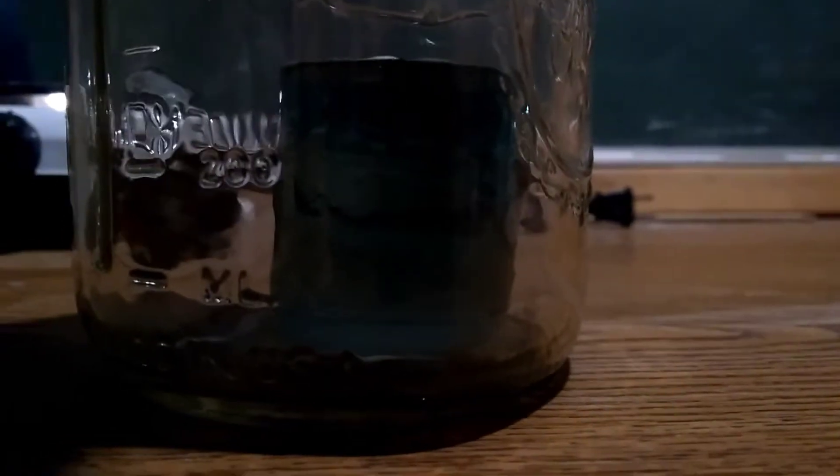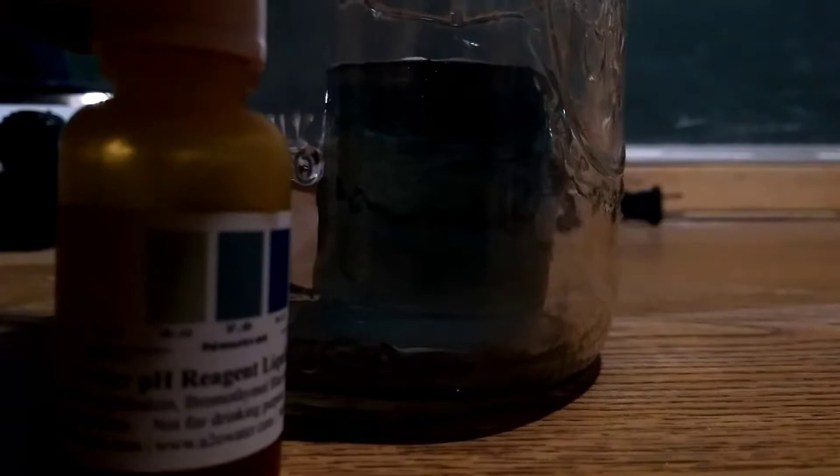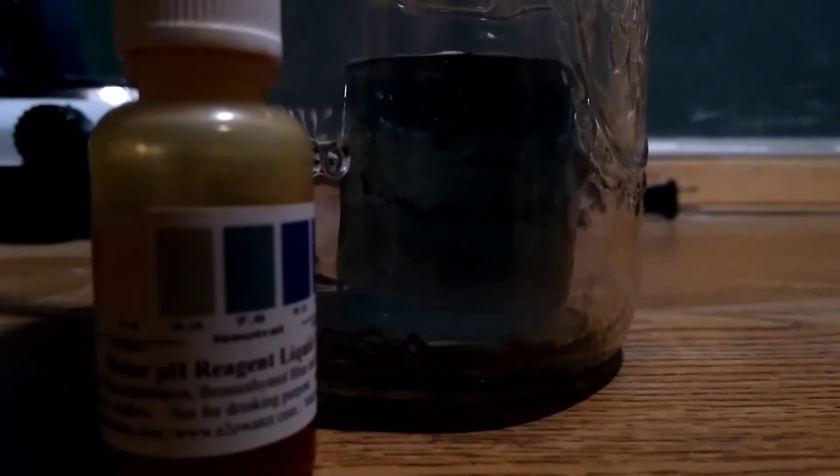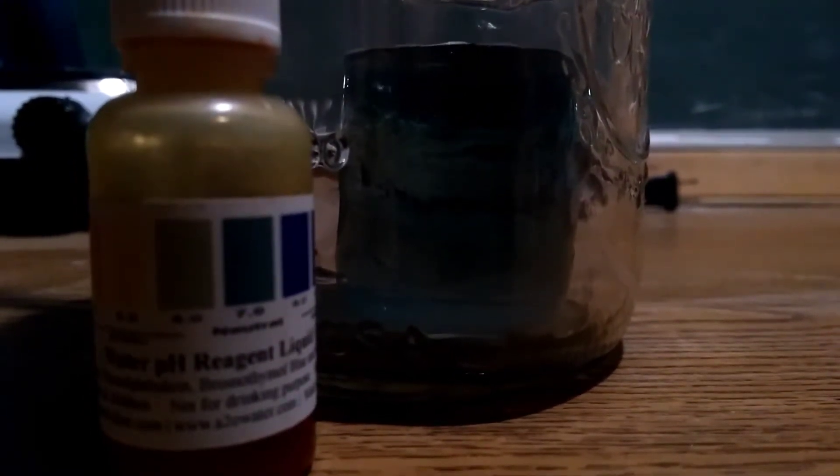So again, it looks exactly the same color to me. As you can tell, that's about the same. But as you can actually see, there are bubbles. However, that really shouldn't have any increase.